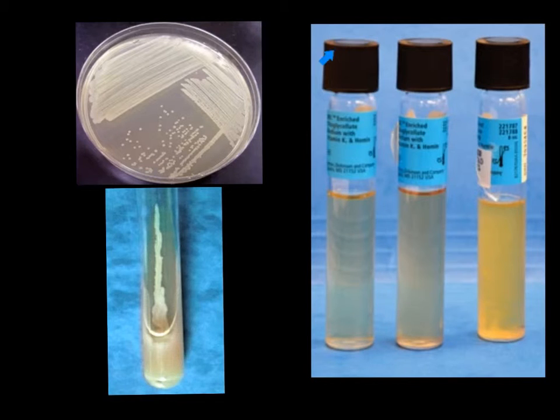Now we do not want to invert this because if we invert our test tube we could spill our fluid out and contaminate ourself.